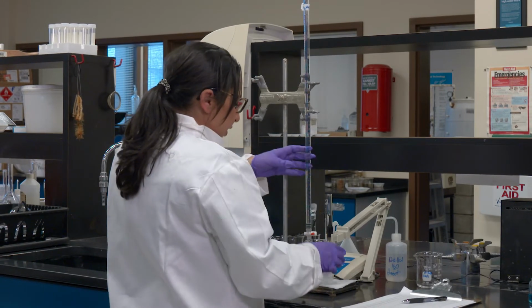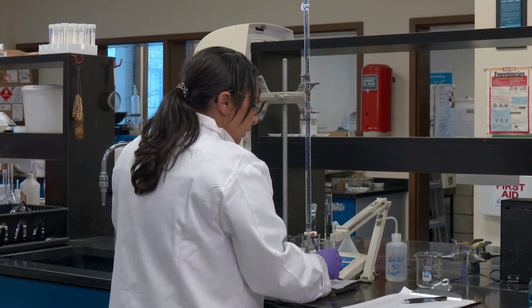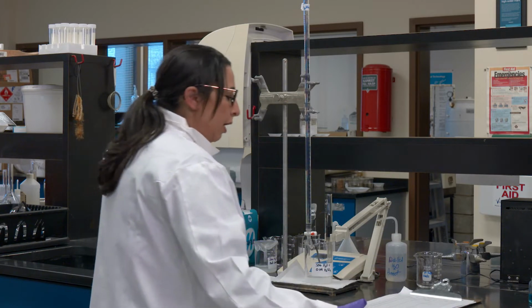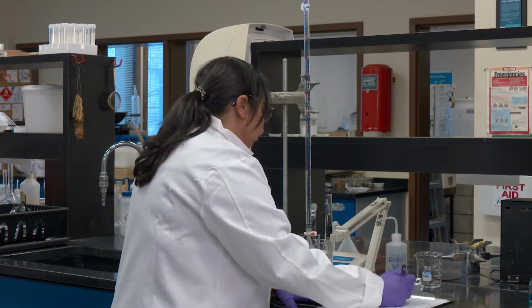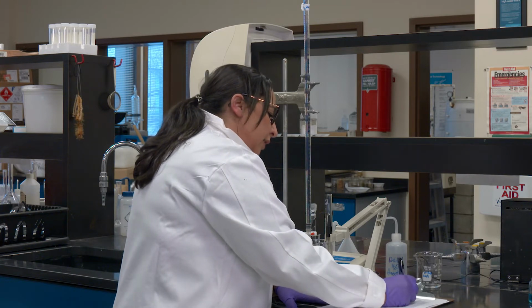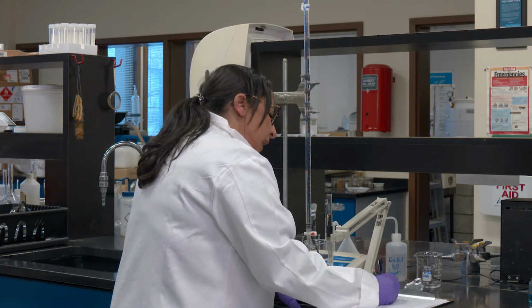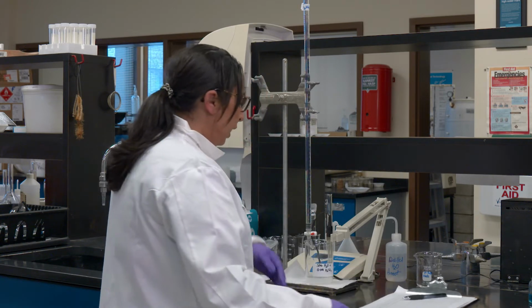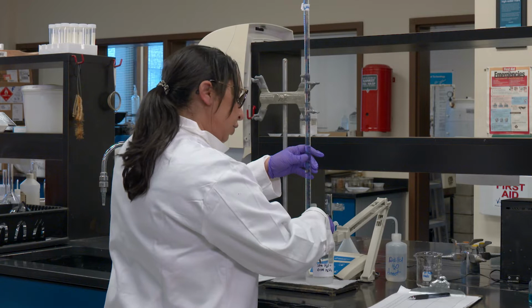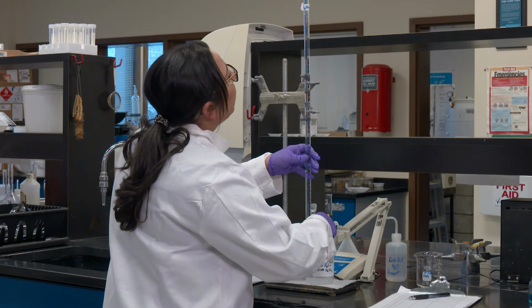Okay, here I am. I just added 1 ml of acid into my solution. As I told you earlier, the data set involves this volume plus the change in pH. So I'm going to keep looking at my pH meter and wait for it to show the change from 9.91, which was my first reading, after I add this 1 ml. Okay, the reading I got was 9.84, so it is dropping down. I'm going to go further using 1 ml because I'm happy with the change it's showing so far, and if I don't have to change, I will stick with 1 ml.